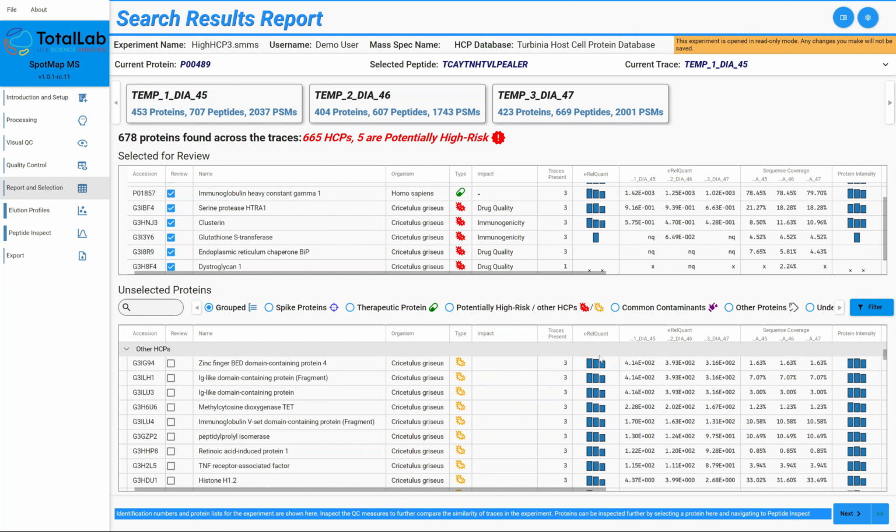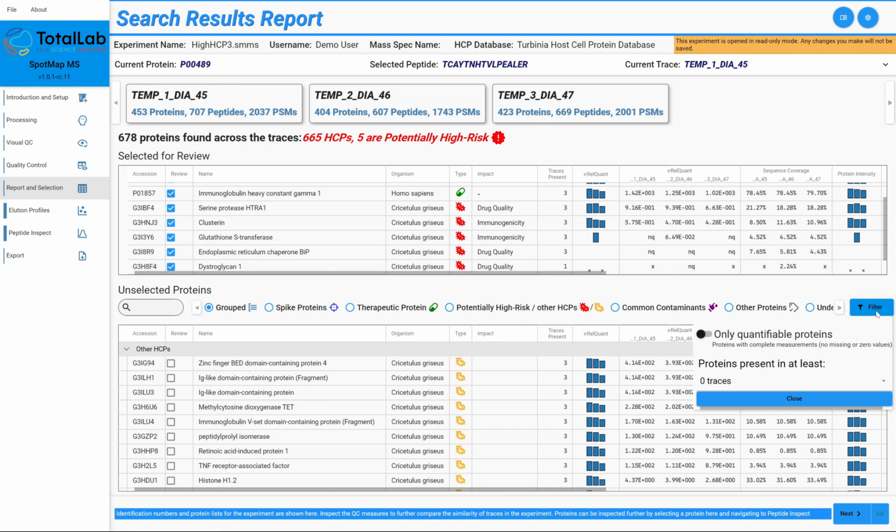But we can go even further than that with the latest version of SpotMap MS. So we've got the ability to include these filters. Now, what I was mentioning before, whereby we would show host cell proteins as present even if we weren't able to quantify the amount that they were present, aka we were taking the very low signals that may have been noise, may have not been noise, and showing that as a measurement. We can turn that off now.